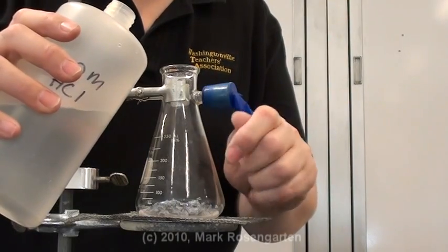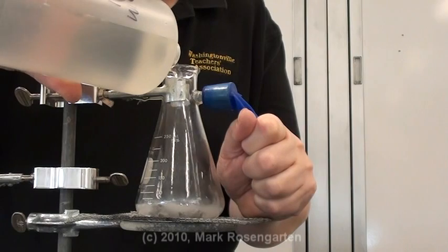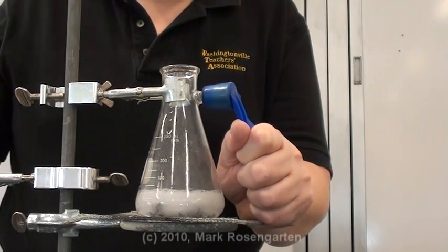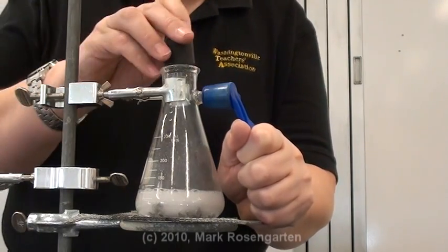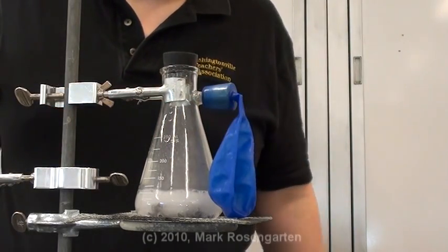And then we add some hydrochloric acid. I'm going to let the hydrogen fill this up so that it displaces any air out from this flask, and then cap it up. And the hydrogen has nowhere to go but into this balloon.